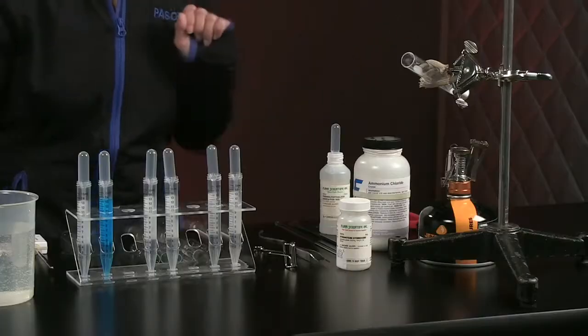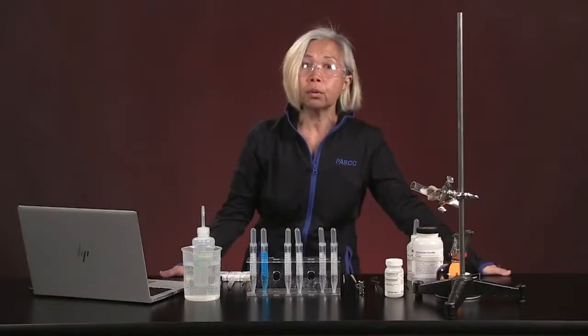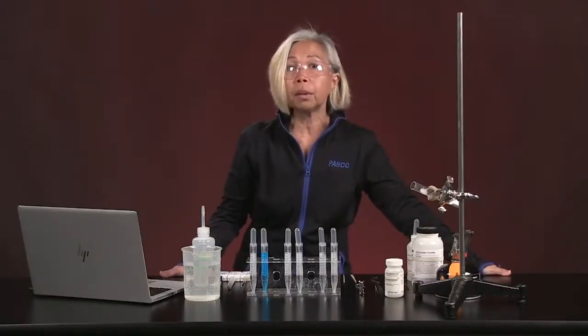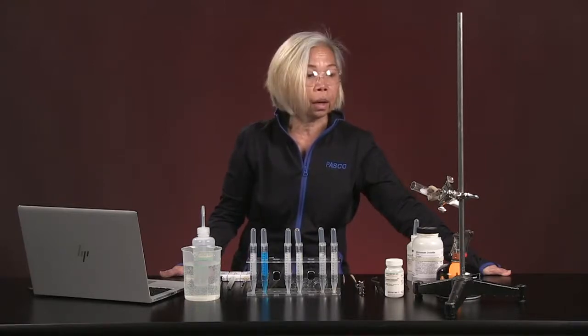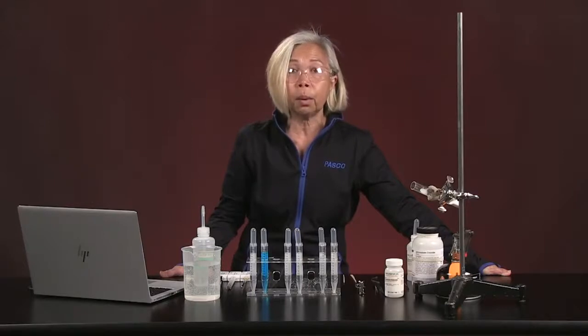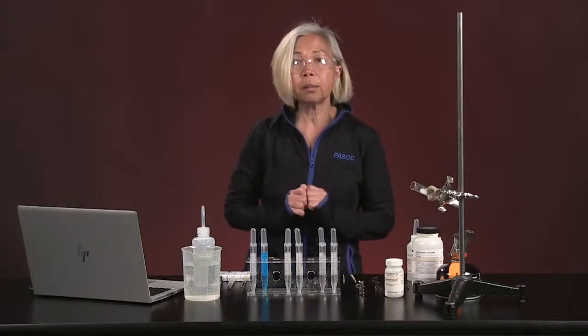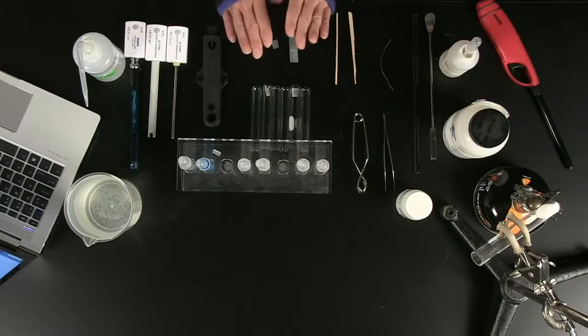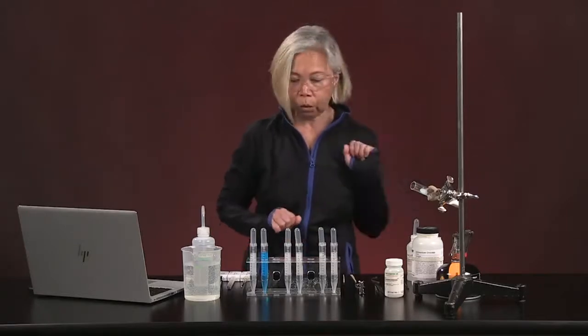And for one of the specifically required labs that we have today, we were supposed to use copper(II) carbonate, but we don't have a sample of copper(II) carbonate available right now. So I'm going to be using sodium bicarbonate, which is also called sodium hydrogen carbonate. In addition to all that, we'll be running our experiments in test tubes where applicable. And we have 7 test tubes set up, 6 here and 1 over there.